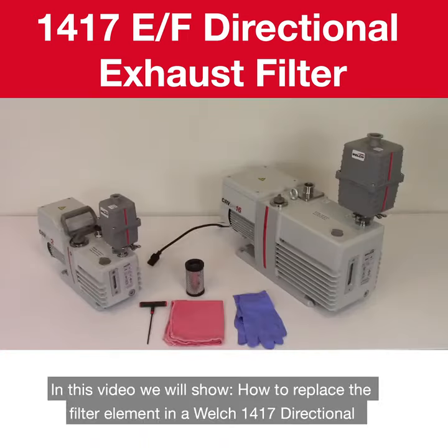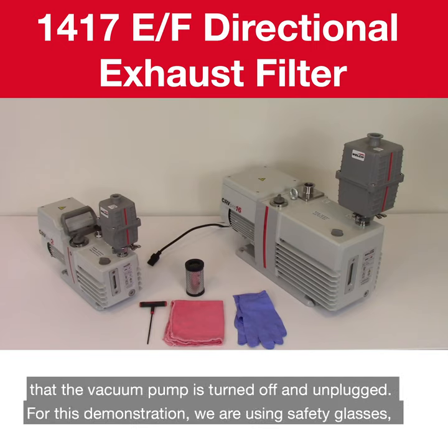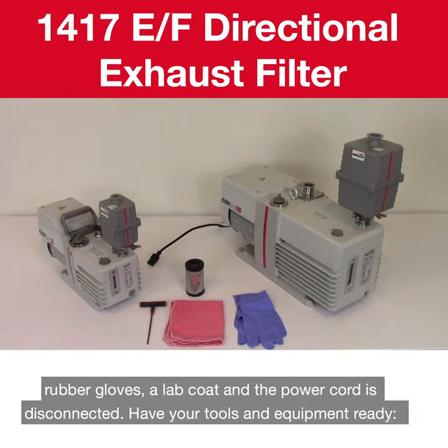In this video, we will show how to replace the filter element in a Welch 1417 directional exhaust filter. Please make sure you are using the proper personal protective equipment and that the vacuum pump is turned off and unplugged. For this demonstration, we are using safety glasses, rubber gloves, a lab coat, and the power cord is disconnected.